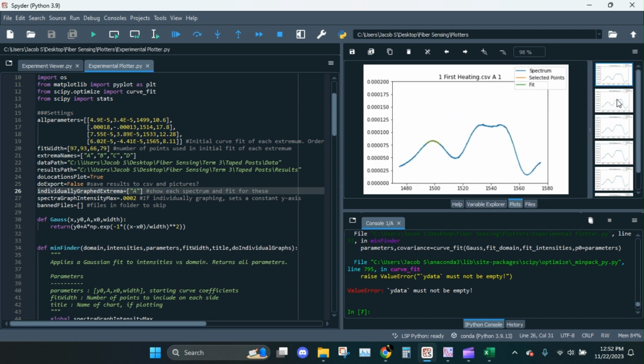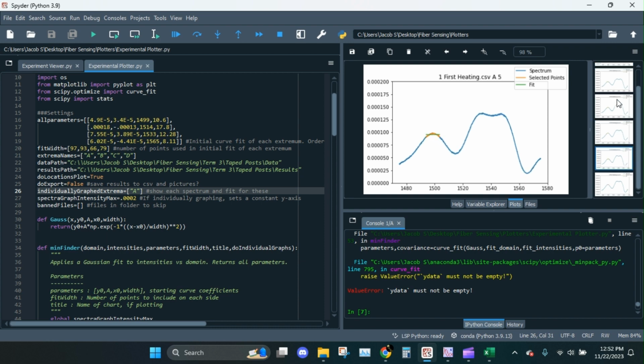So let's see what went wrong here. That's fine, that's fine, that's fine. At that point, you could see how its fit was just a line. It didn't do a proper fit there. And I'm guessing that's because there's not enough data points.